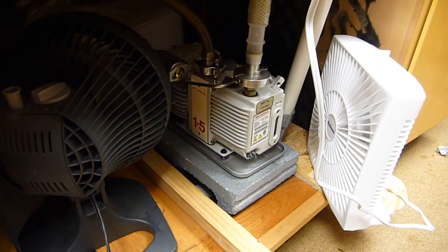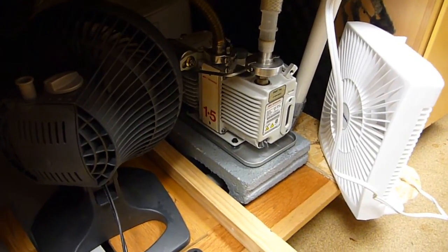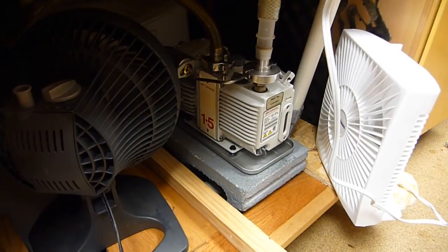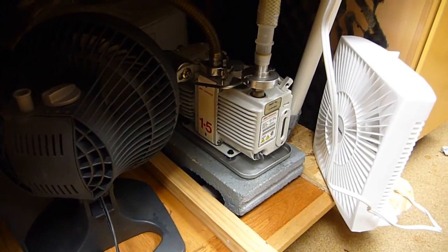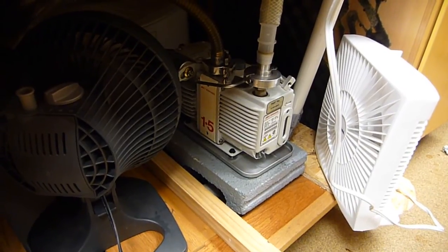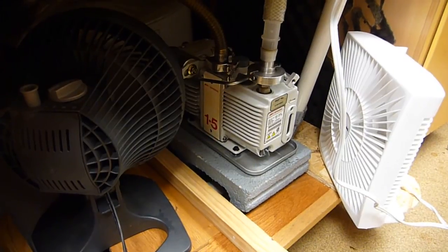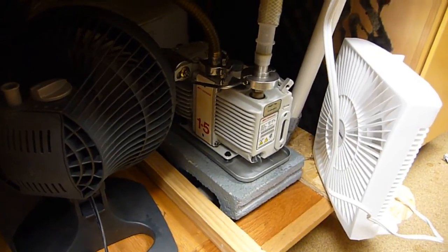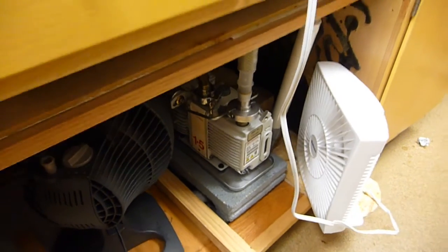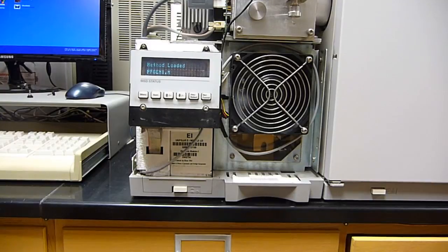Trick number one, we have the rough pump separated a goodly distance, roughly 6 to 8 feet of tubing away from the GC mass spec system. This way, if the diffusion pump sucks back any of the rough pump oil, it has a long way to go, and it's unlikely to contaminate the diffusion pump oil with rough pump oil. We also, as standard procedure, have fans on our rough pump. Heat kills, and so the cooler you can keep a pump, the better. A diffusion pump works by boiling oil and then cooling it against the surface of the outside of the pump.